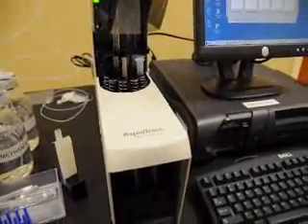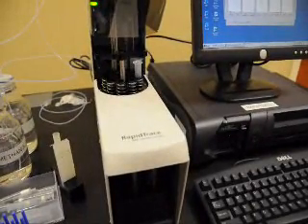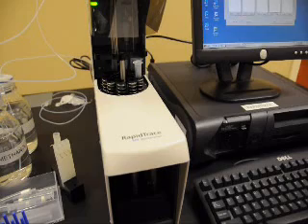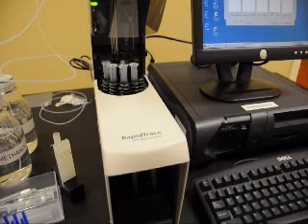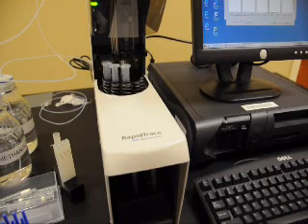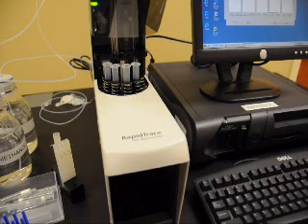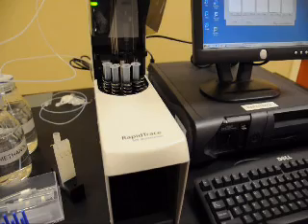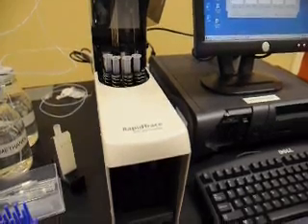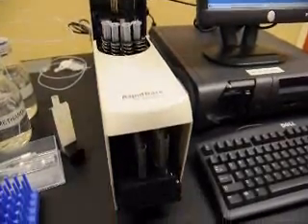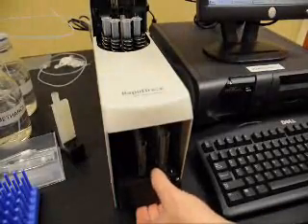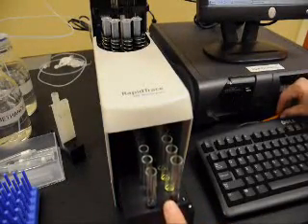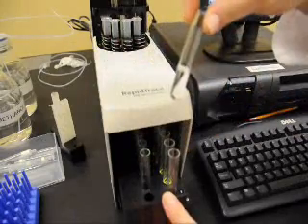At the completion of the run, the column plunger will come out of the SPE column. And the rack will come out of the unit and be presented to us. At this point, the fraction will be in the fraction test tube.